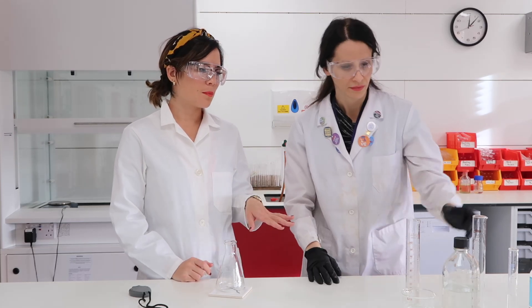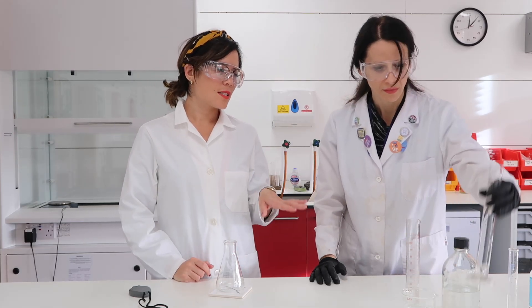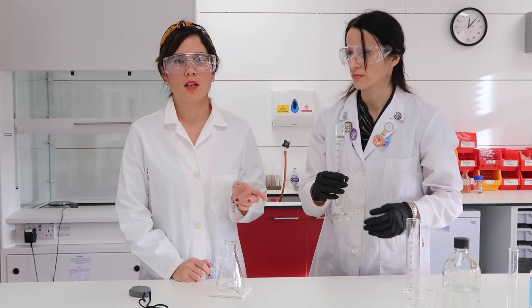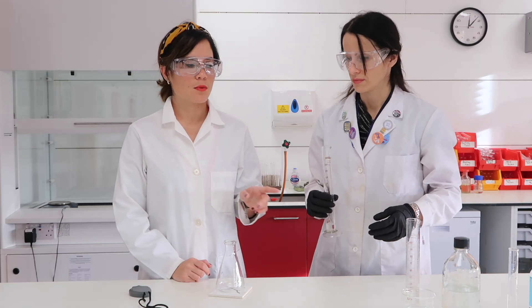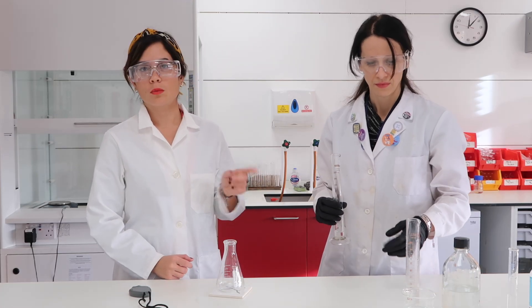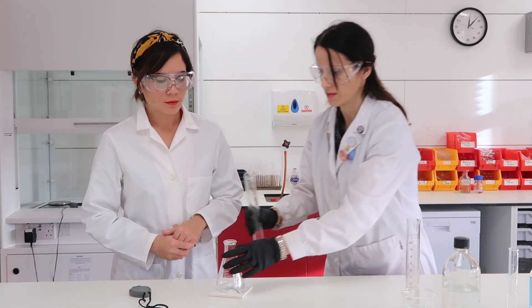We're only going to do two concentrations. Starting with the lowest concentration, we've got 10 cubic centimetres of sodium thiosulfate mixed with 40 cubic centimetres of water.